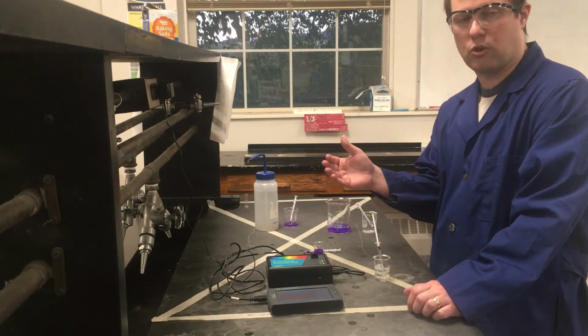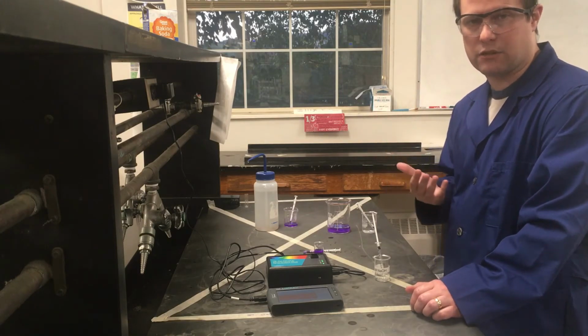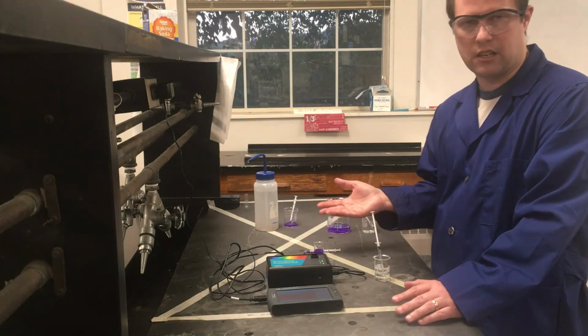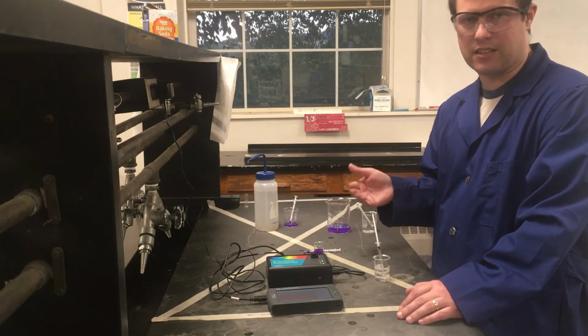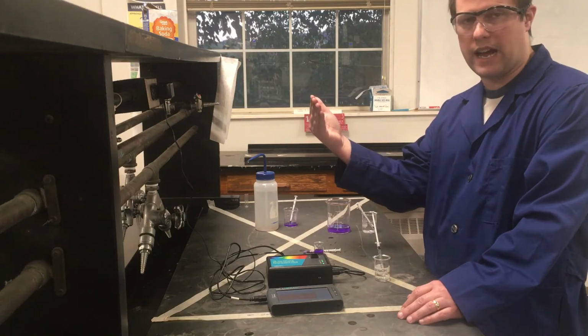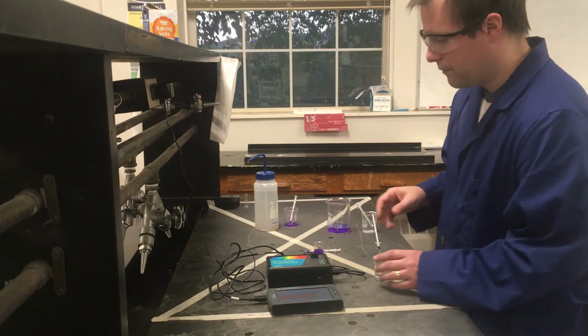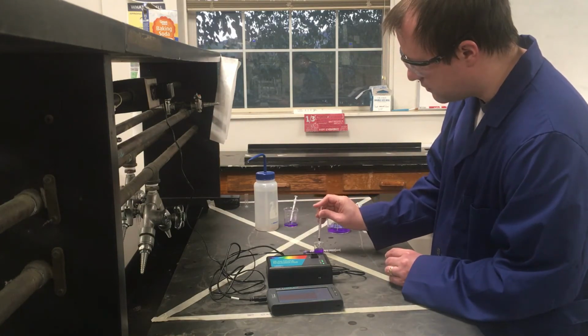It's going to measure the absorbance over a 10-minute interval, and I should see our absorbance constantly decreasing, because as our crystal violet reacts, it's going to start losing its color. It's going to lose some of that color intensity because there's less and less crystal violet there that has that color that's absorbing the light. And so we should be able to monitor the progress of our reaction as we see the absorbance value drop over time. So I'm going to go ahead and add my 1 milliliter sodium hydroxide to this.